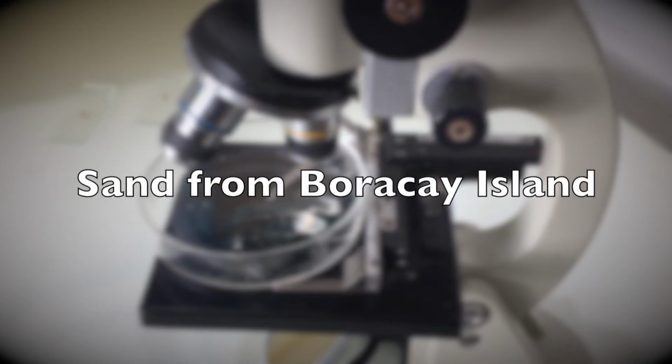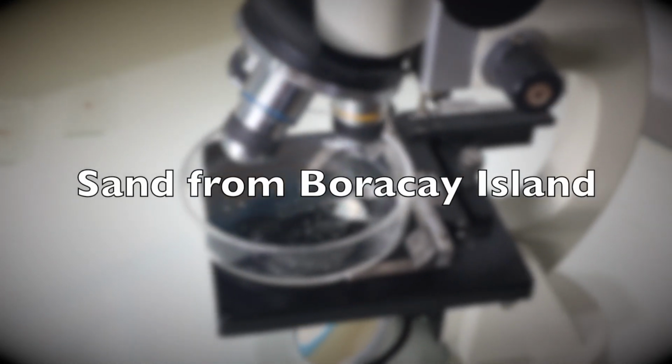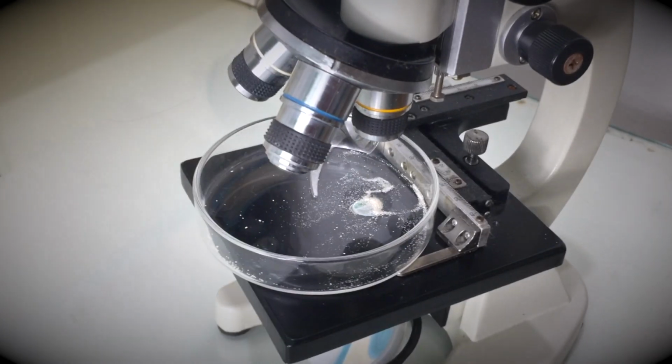Next is sand from Boracay Island. Take note that we used a petri dish instead of a slide.